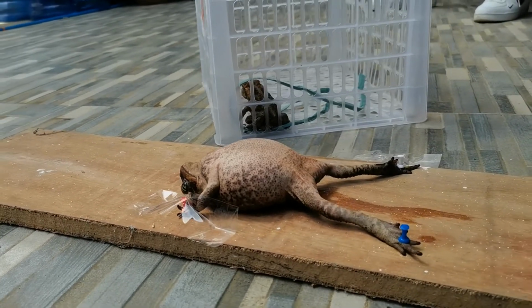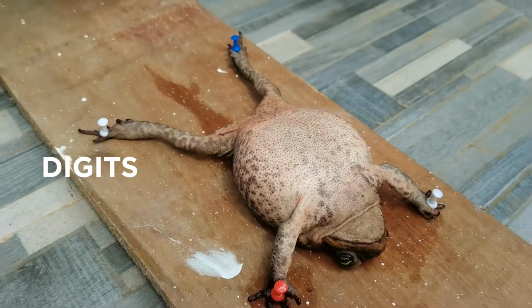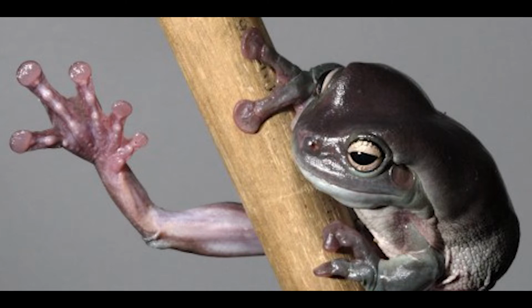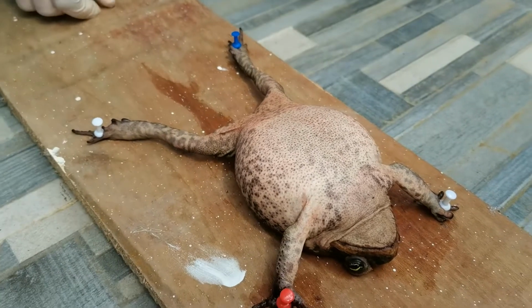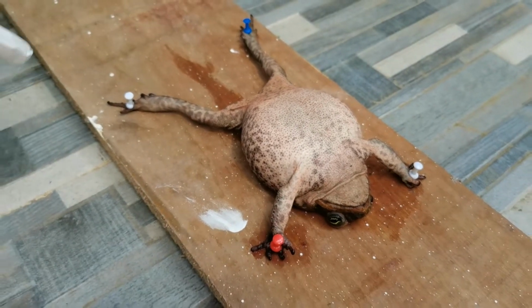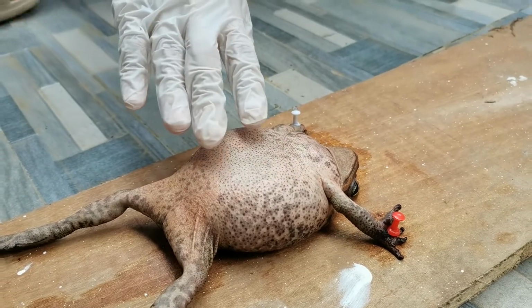Examine the front and hind limbs of the frog. You can find the digits, which are finger-like projections on the forelimbs and hind limbs. We located the hind limbs, which are the longer and more muscular limbs of the frog, as well as the forelimbs, which are shorter than the hind limbs.